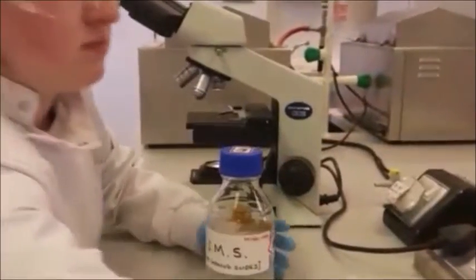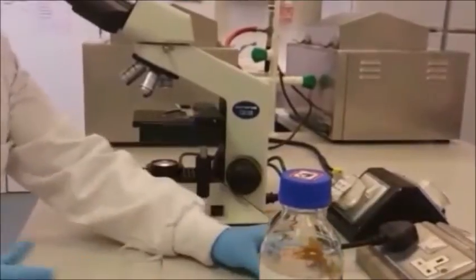Using IMS solution clean the objective lens starting at the lowest magnification.